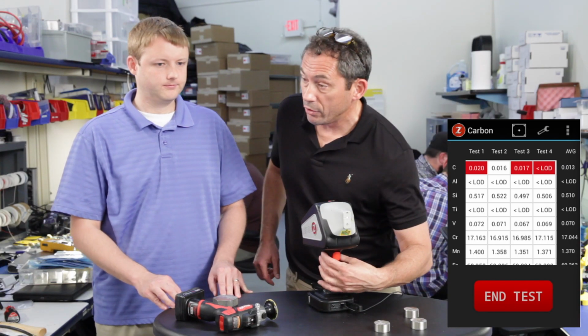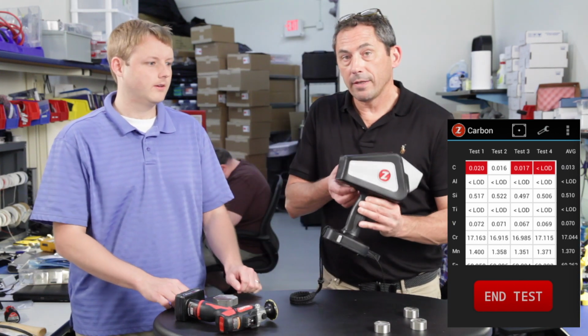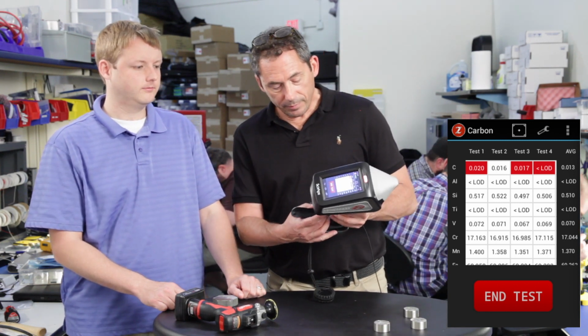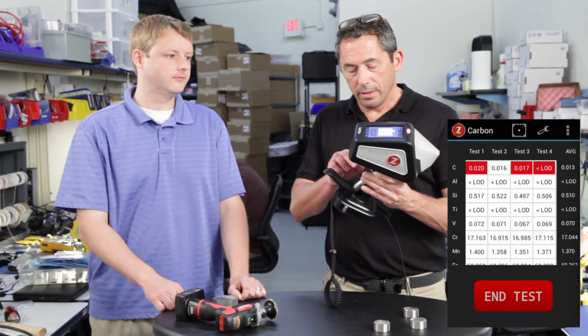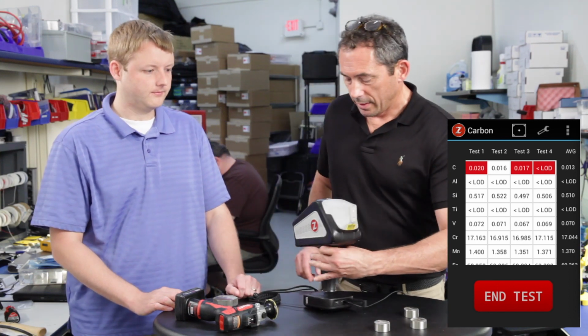And again, just to remind you, besides the laser and all the other good features, the key to that performance is that argon purge. So now when you have to go up on a ladder, climb up on a tower, wherever you have to go, you're not having to lift the analyzer with a crane and lift an argon tank with a crane. It's all right here in this little thing. So this comes out, you replace it, a couple of bucks to replace it, and you're ready to go.